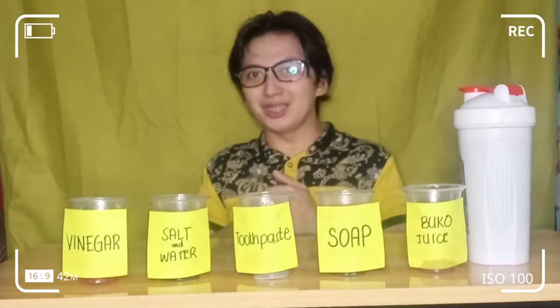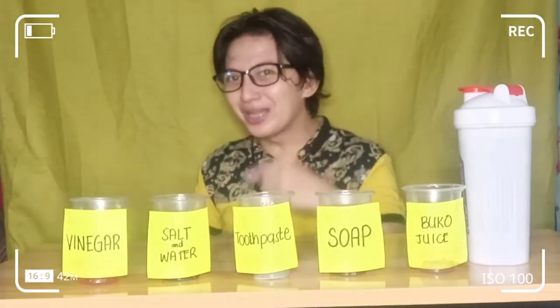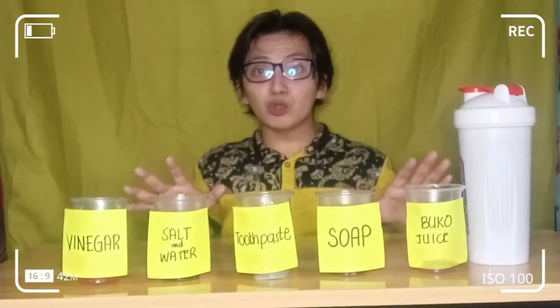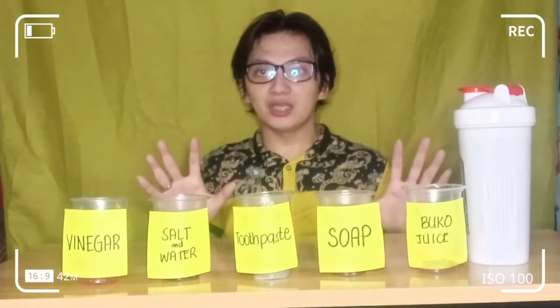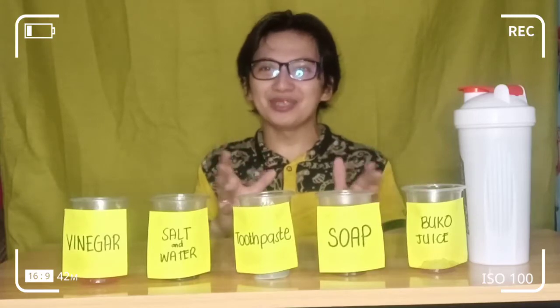Even though you are at home, you need to follow these rules so that we will all stay safe at home. So I think you are ready to do our experimentation today. We have here all the materials — we have 10 substances for you to identify, but I only have 5, and the other 5 you will be the one to do. I will just show you how to do it.